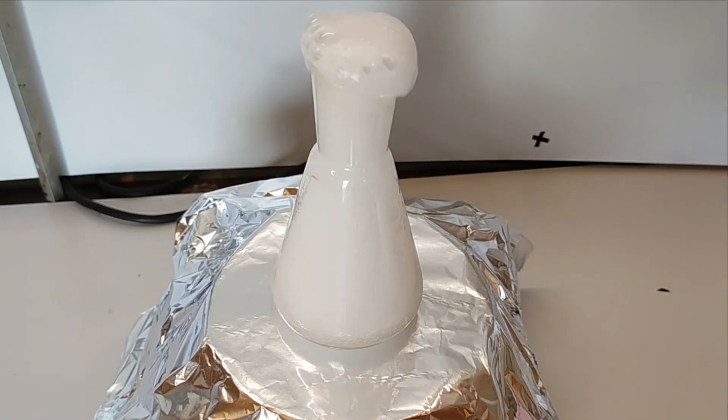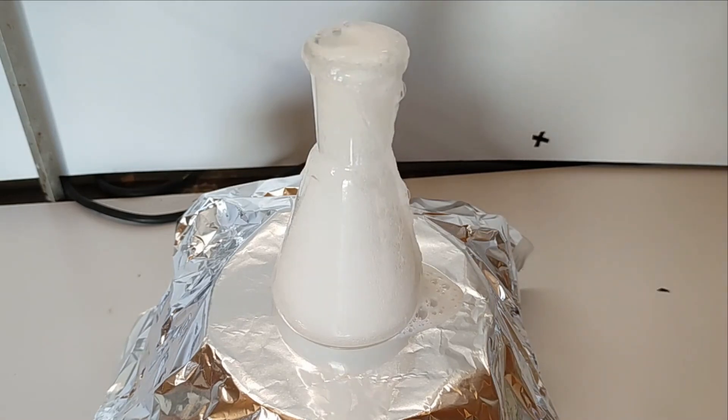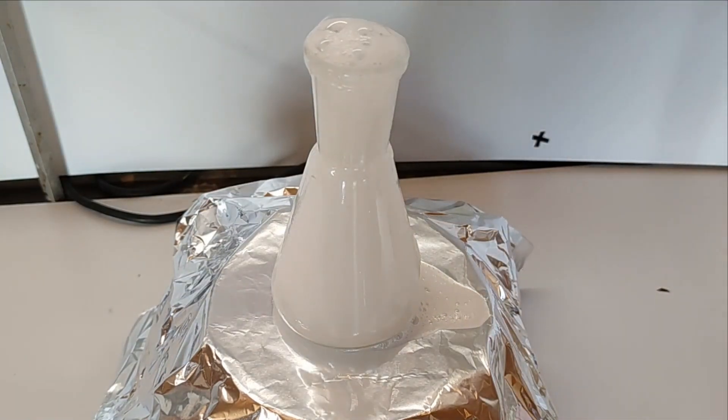Here you can see where I added the acetic acid too quickly and the solution foamed over. Not cool.